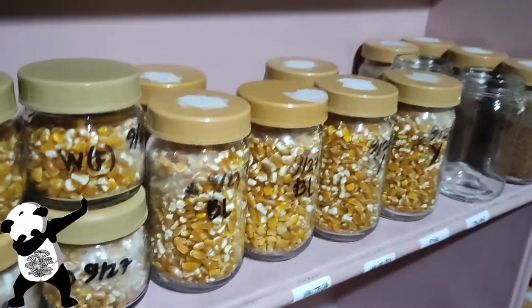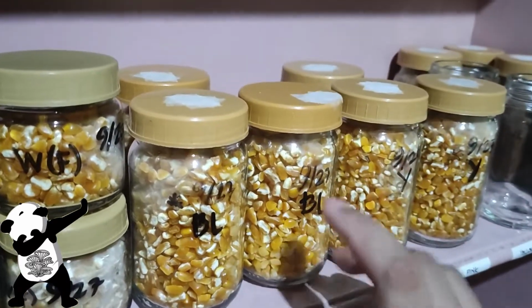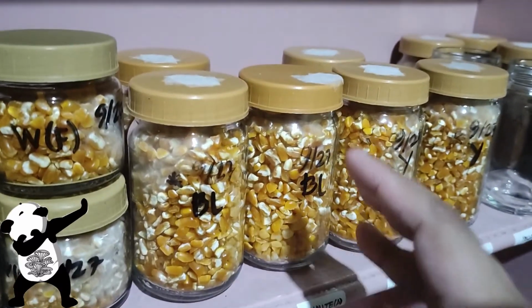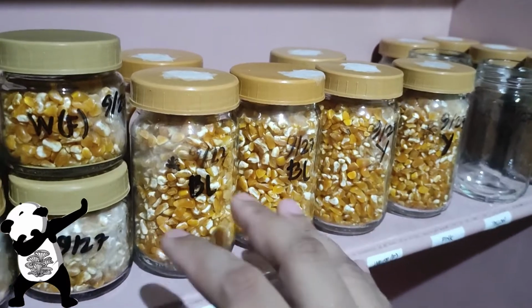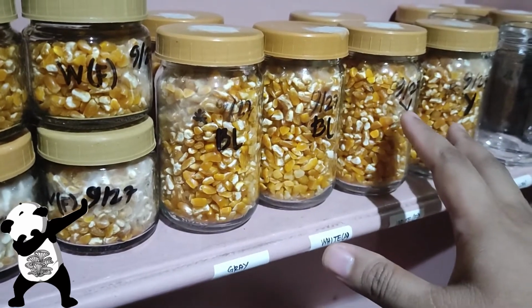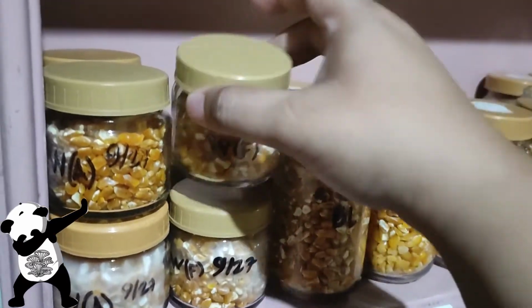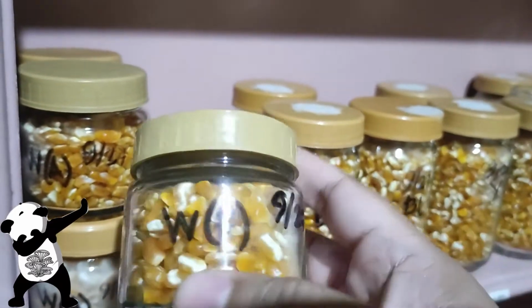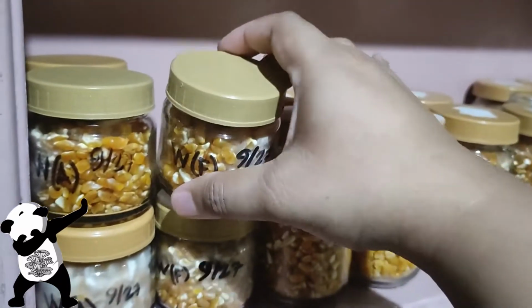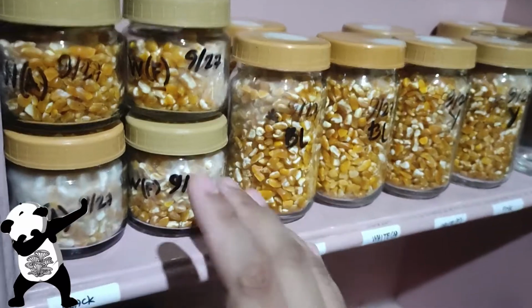prior to sterilization. The jars that don't have any asterisks only have 1 layer of micropore tape, and after sterilization I put on another 2 layers, and it seems like that is not the issue, because these grains are clean. Also, the smaller jars don't have any holes, and we have a direct tissue on these grains, and it seems to be doing fine as well. I did check the inside, which is not advisable, but I did, and they're really looking good.